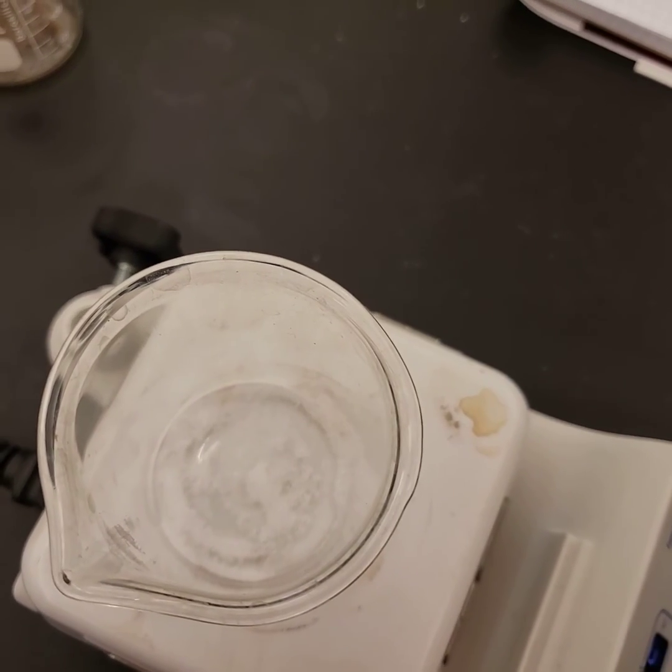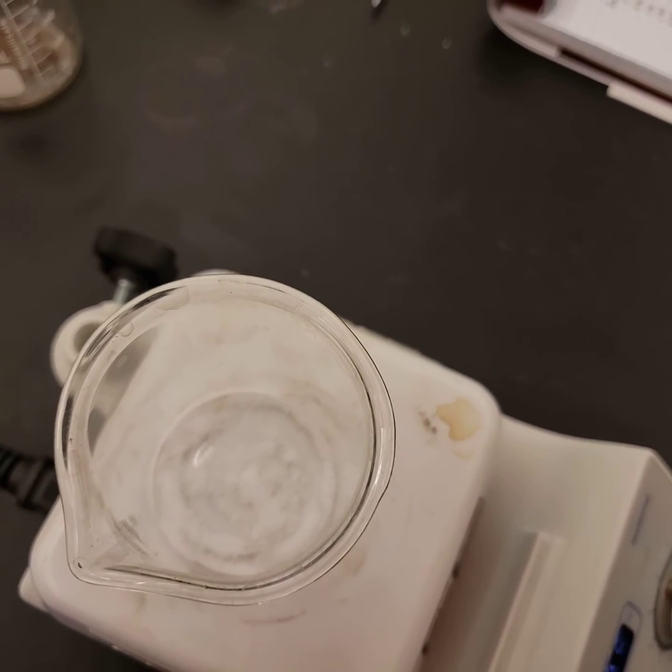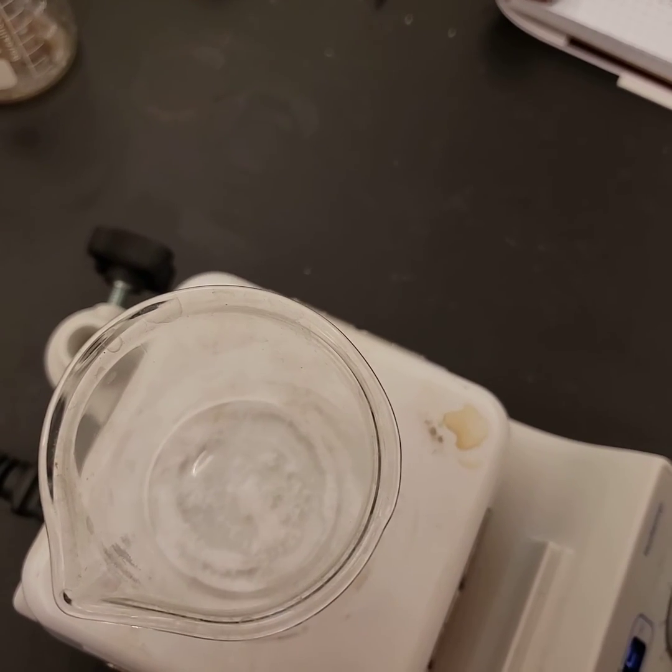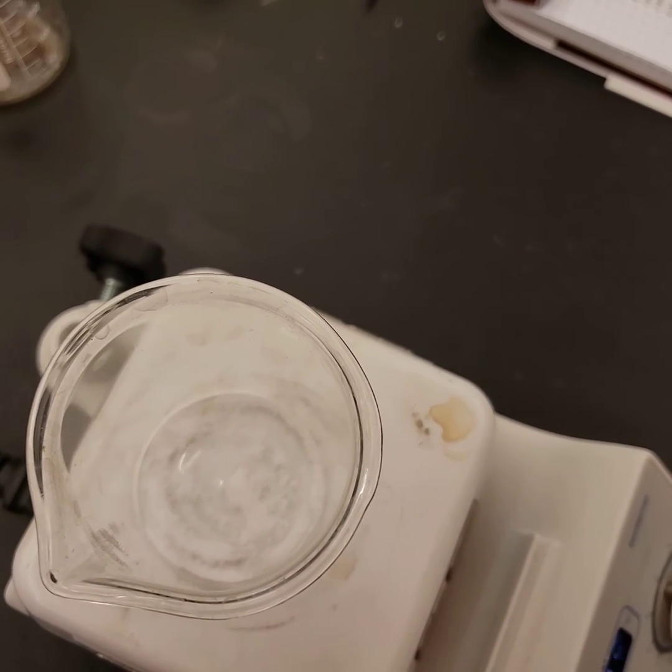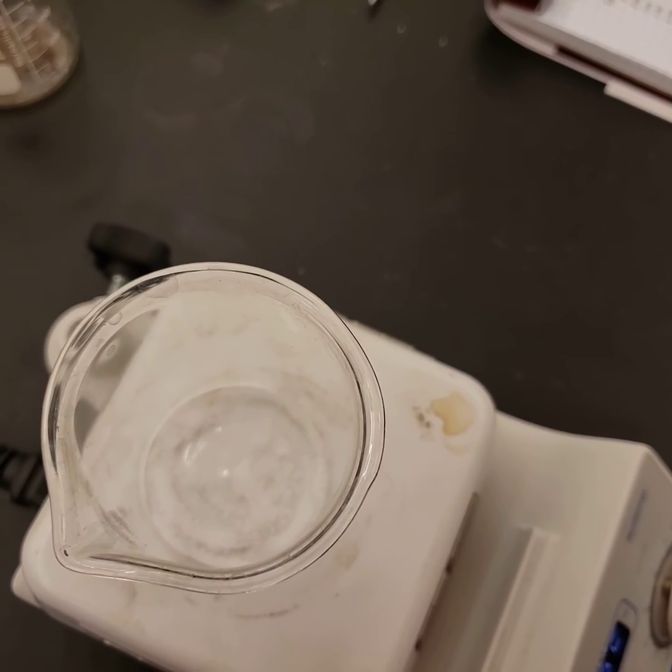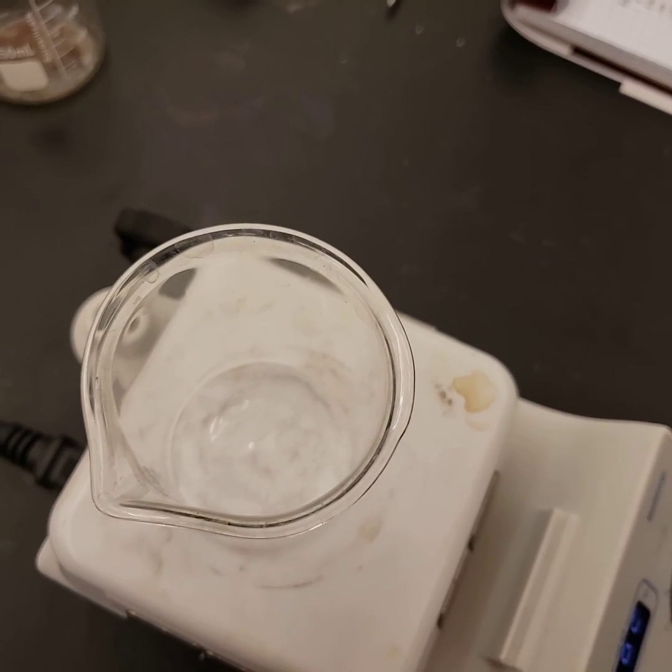Now I'm not going to run this the entire time because it takes a while, but what's going to happen in the end here is all of this is going to disappear. It is going to break down completely into gas byproducts which are just going to dissipate into the atmosphere. And again, this is the ammonium bicarbonate.